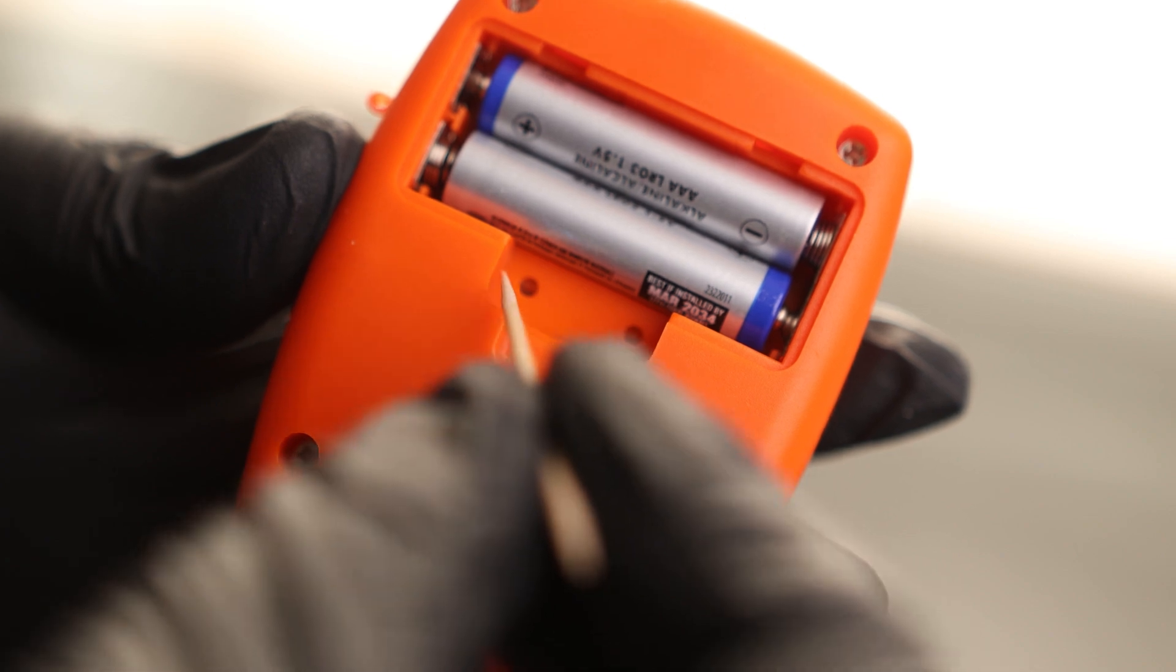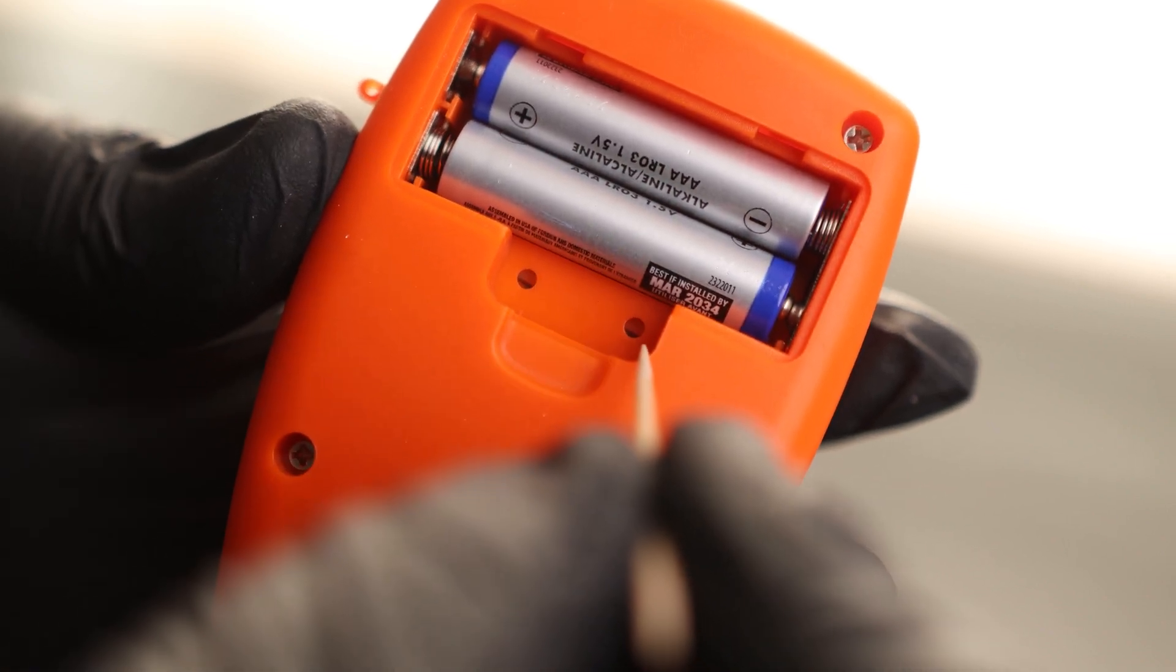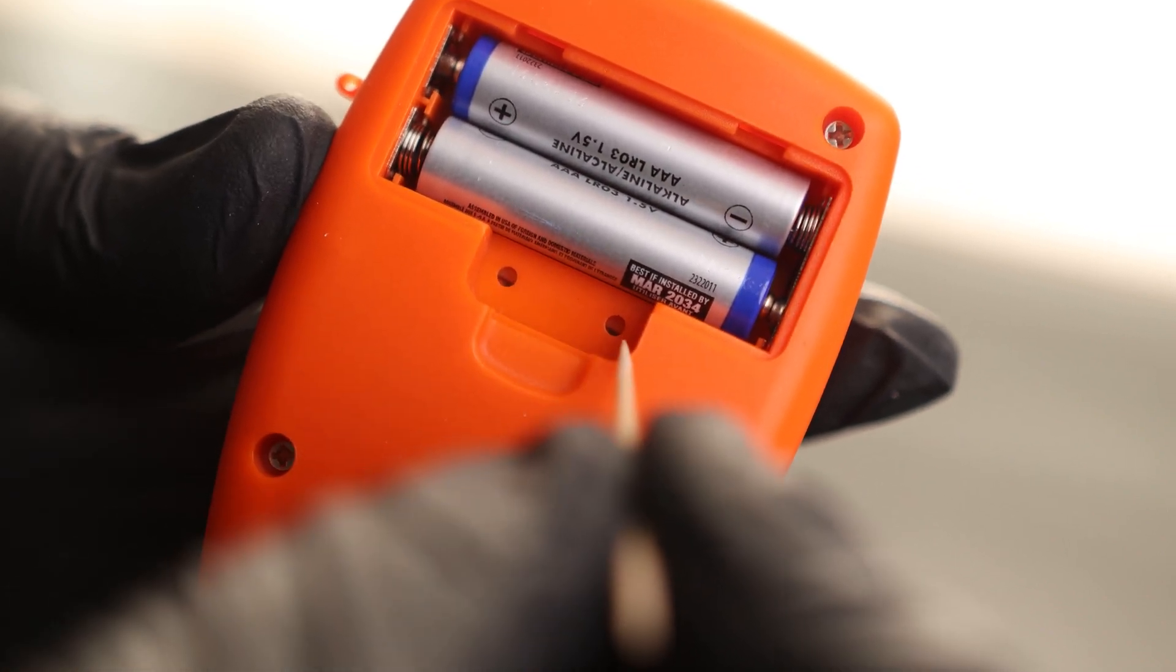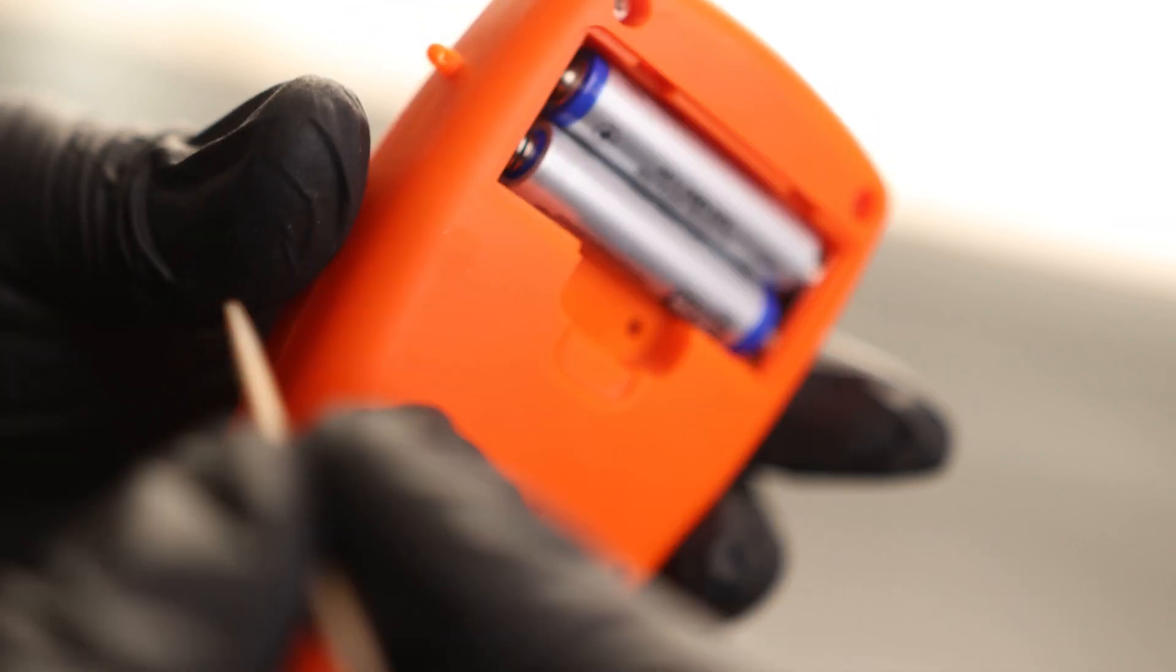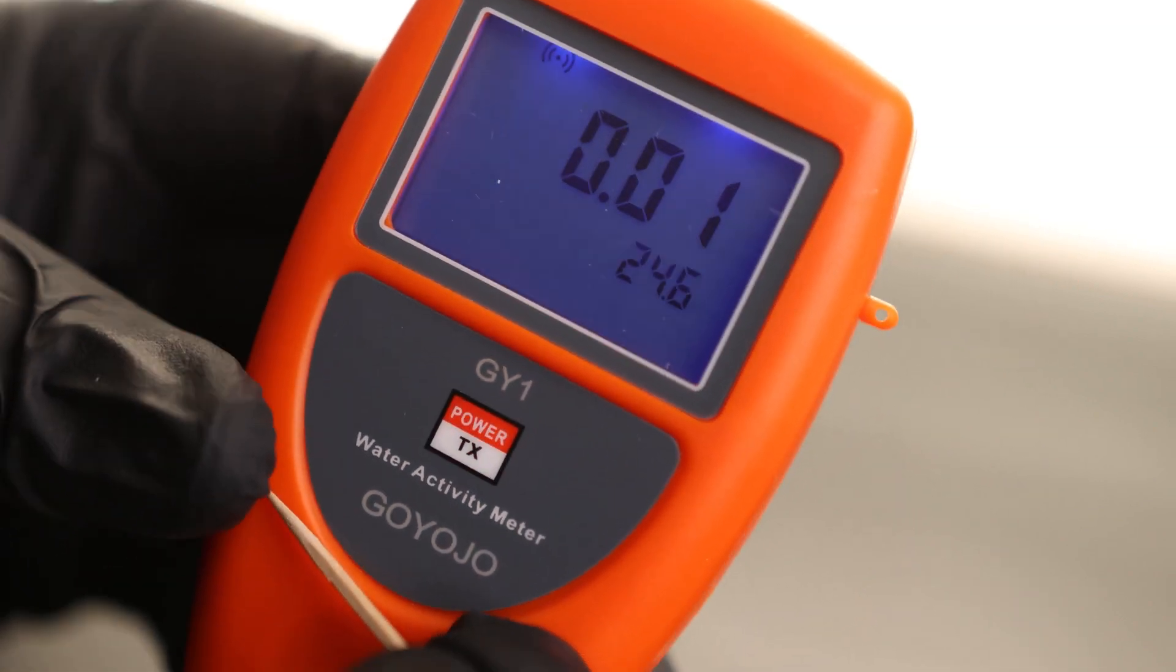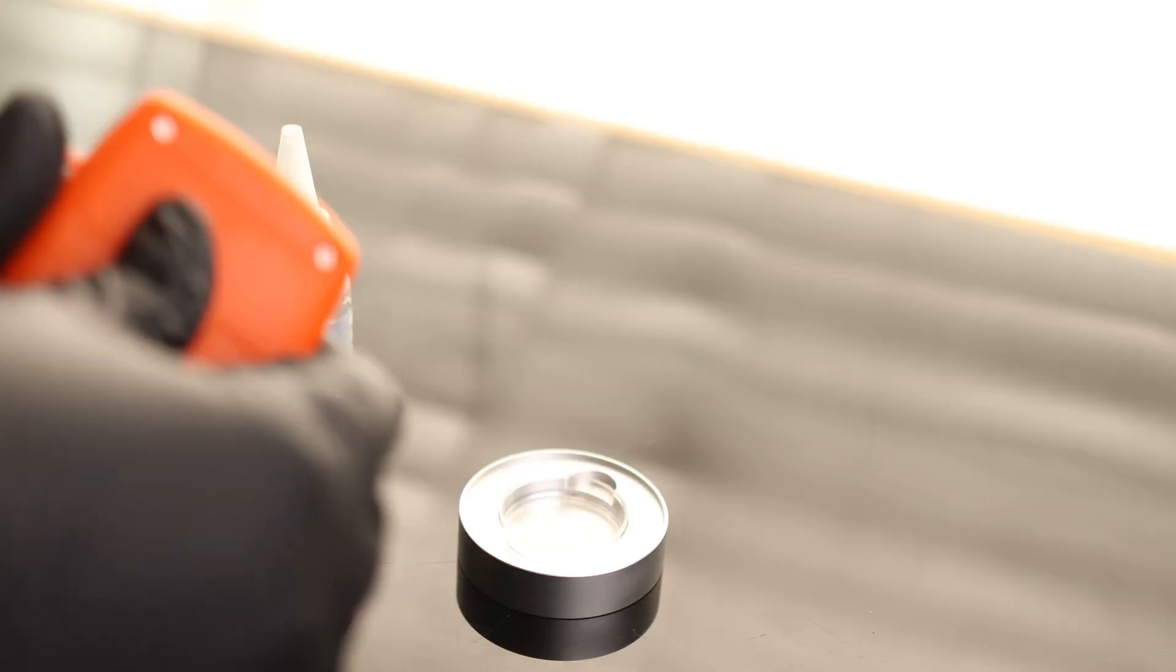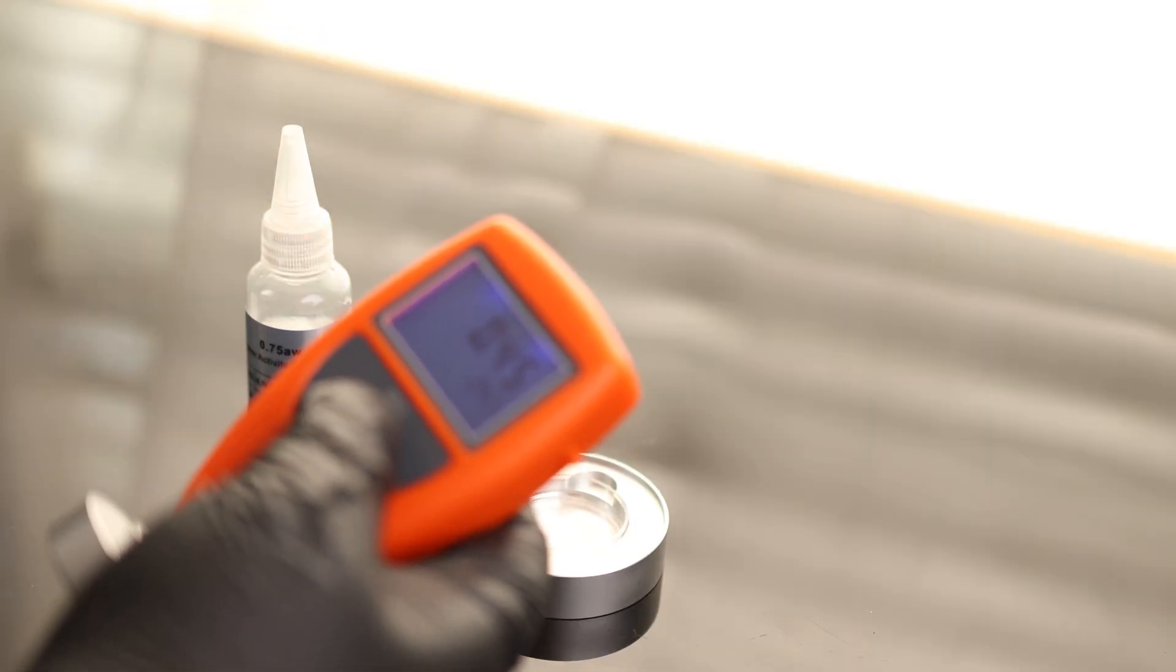In the battery compartment, we've got two buttons here. We want to press on the little orange piece right in there. That is the actual button. The left side goes up, the right side goes down. So we will hear a beep. That means we should be at 0.01 now. So this should be correctly calibrated. I'm going to set that and then we will shut this back off.